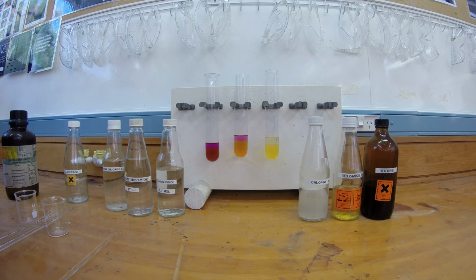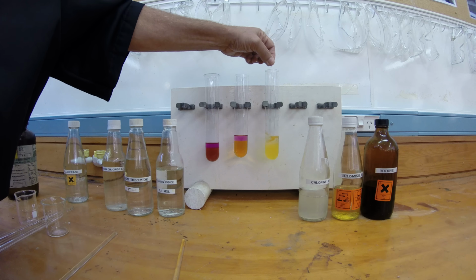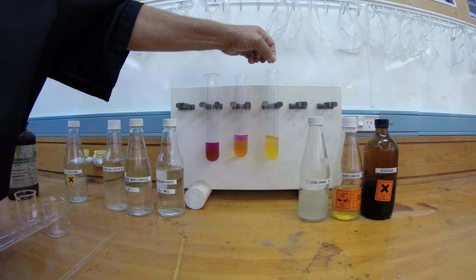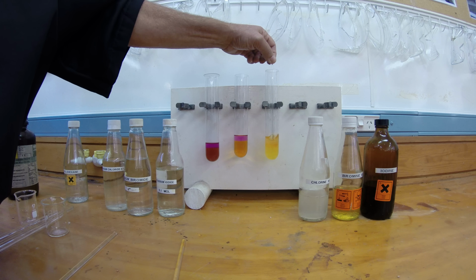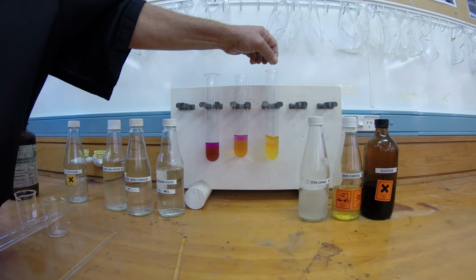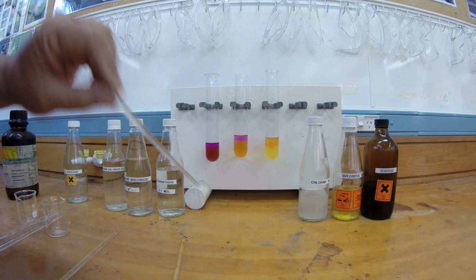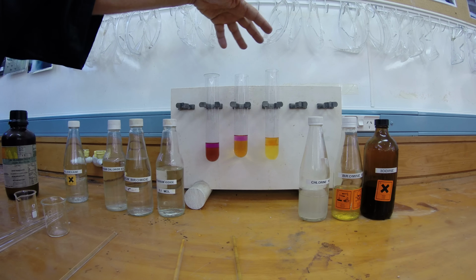Now I can get it to go a little bit better by taking it out and shaking it up with my hands, which I won't do right at the moment. And this one here, we've got that sort of orangey colour in the bottom. Again, you can see that the colour is moving more into the top layer. But this time it's not going purple, it's going to an orange colour. And that is the difference between the halogens that we've managed to produce. All 3 had a darkish colour, right?